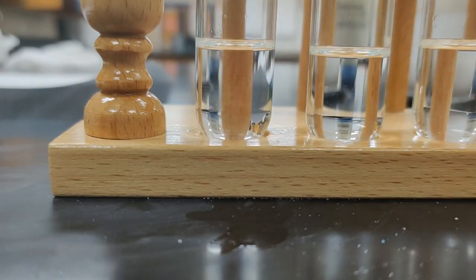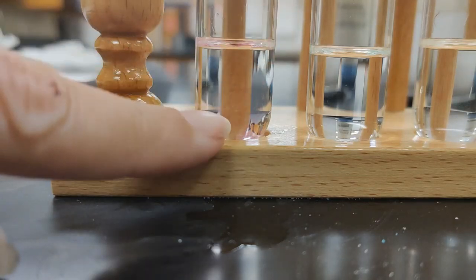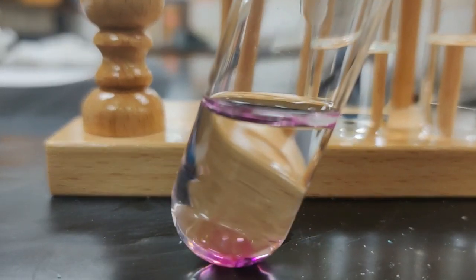All right, we're going to test our same 6 substances now in hexane, which is a non-polar solvent, all C's and H's. So we'll just gather a couple little bits of iodine and drop that in. That's interesting. When I drop in the iodine, it looks really kind of purple. In fact, if I look at that closely, wow, that's interesting. Look at that purple moving around in there.